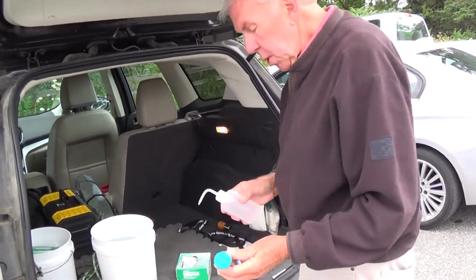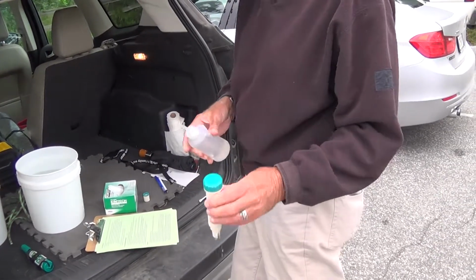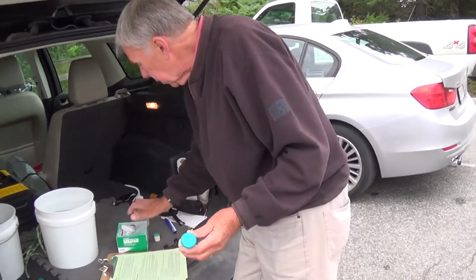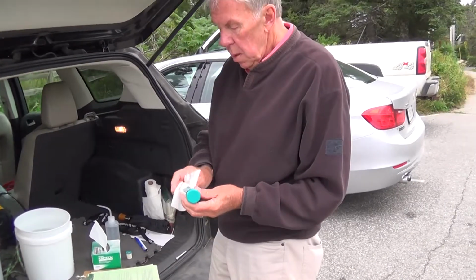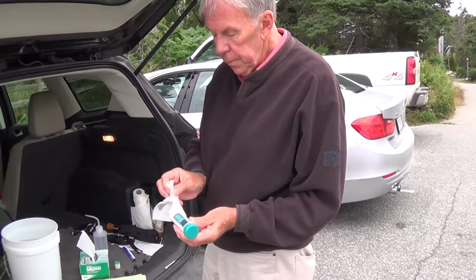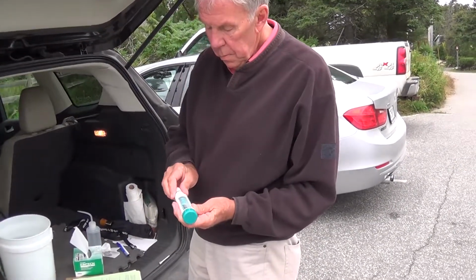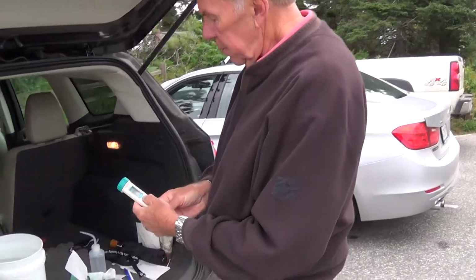Alright, I'm going to rinse this off. Just dab this to dry it a bit. Put the cover back on. And again, turn it off.